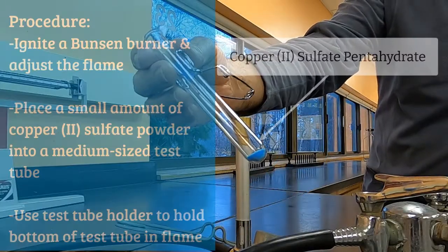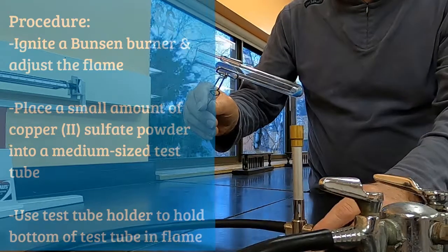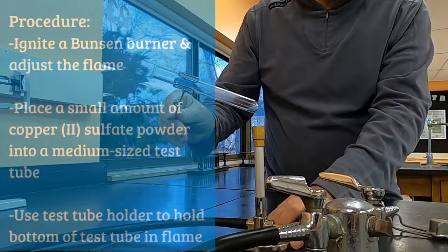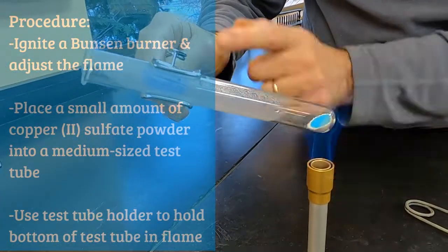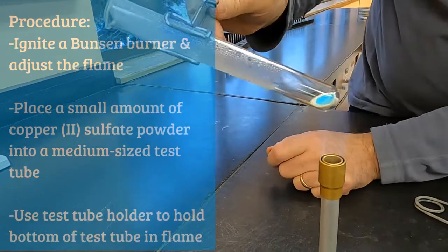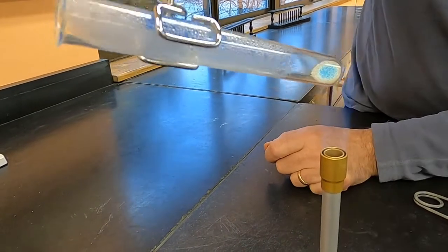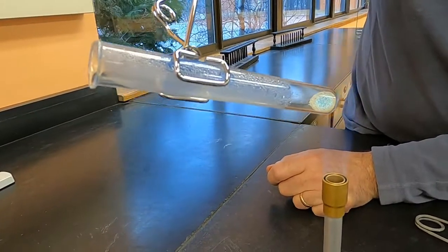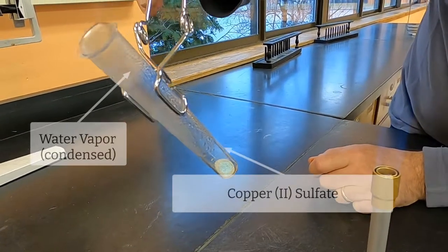This reaction is going to be using heat to remove the water that is incorporated into a hydrate. In this case, it's copper 2 sulfate pentahydrate, and when it has the water molecules locked into the crystal structure, it has a blue color. As it loses the water molecules, it becomes white, and that is called anhydrate. It is only copper 2 sulfate. You can notice that the water is condensing on the walls of the test tube.